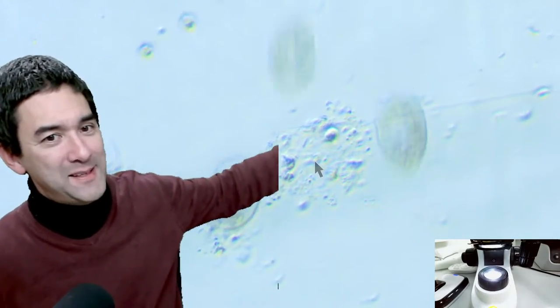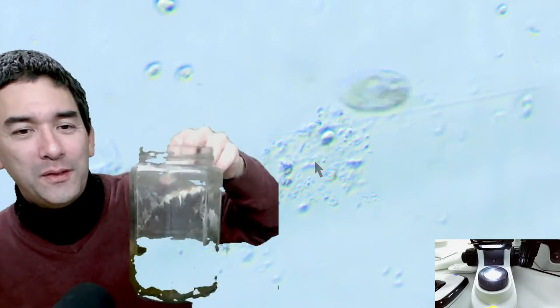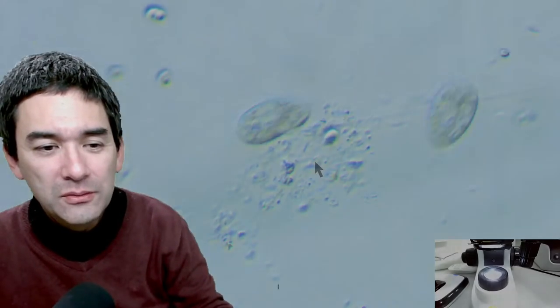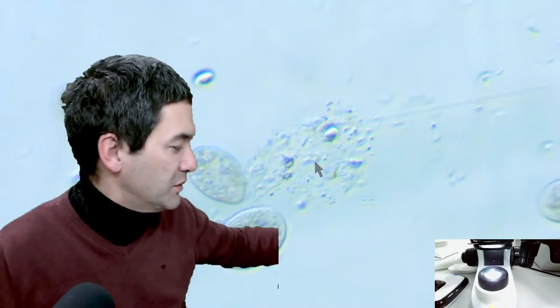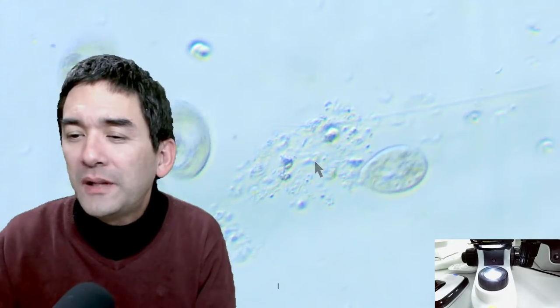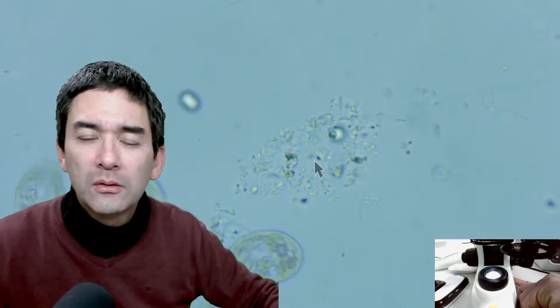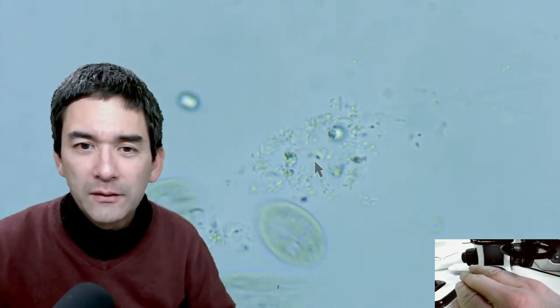How do you maintain your algae cultures? It's pretty basic — I simply have a jar with algae and every time the water evaporates I add a little bit more. I've been keeping this for months. Someone from Brazil mentions putting their thumb over half the light source to obtain oblique lighting — let's try it out! I'm going to remove the filter first.